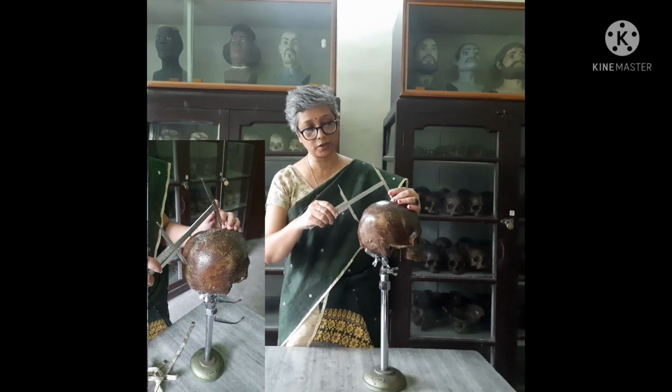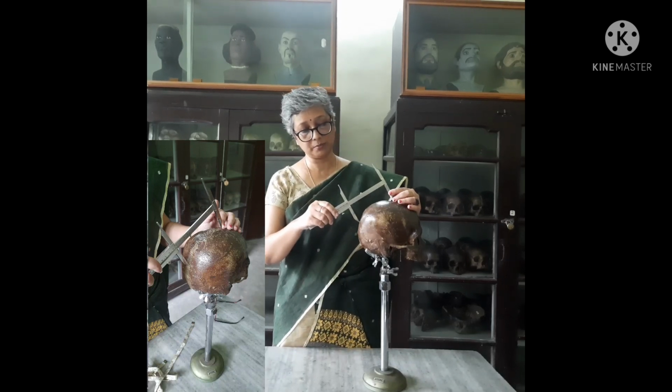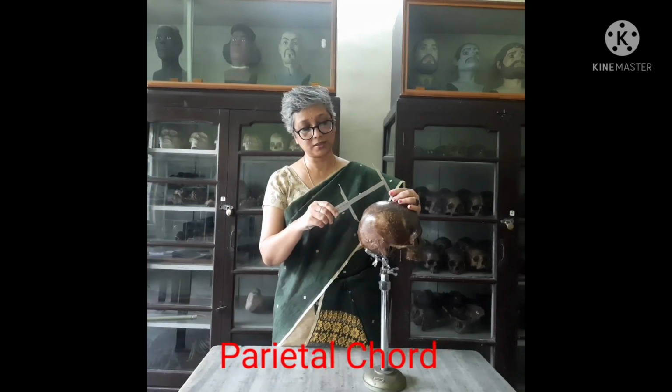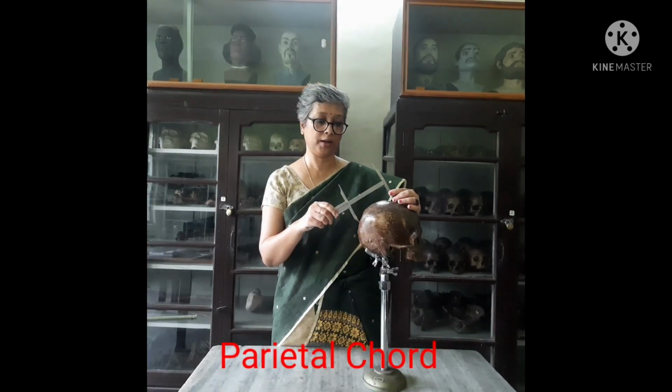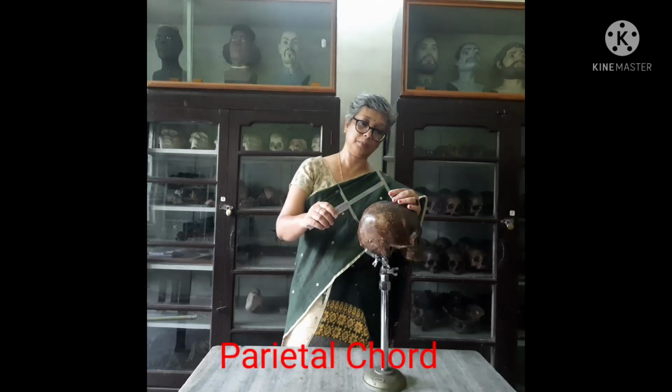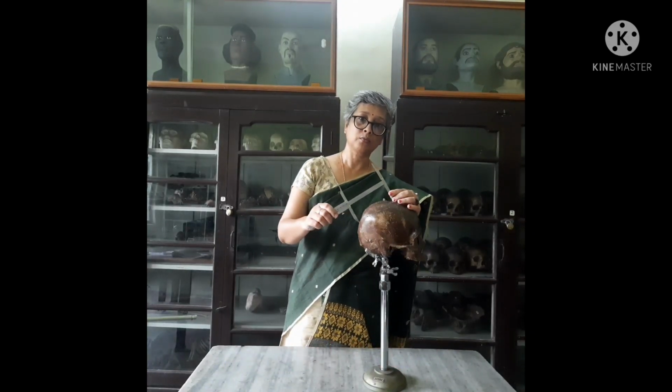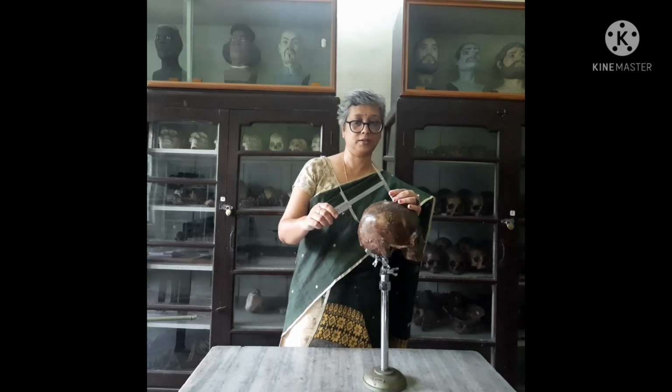and slide the other to the point of the lambda, which is the meeting point of the lambdoidal suture and the sagittal suture. The lambdoidal suture is between the occipital and the two parietal bones. So this straight distance is the parietal chord. The length of the parietal chord is read on the marks which are given on the bar of the sliding caliper.